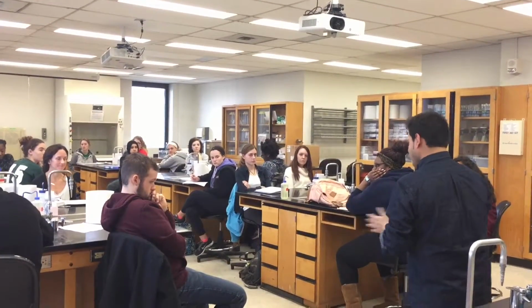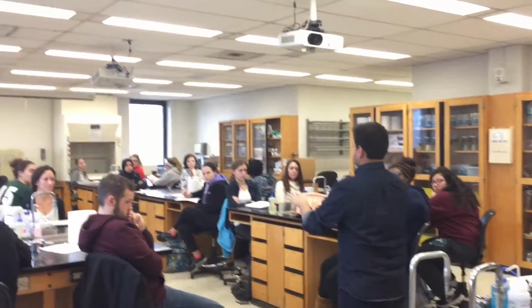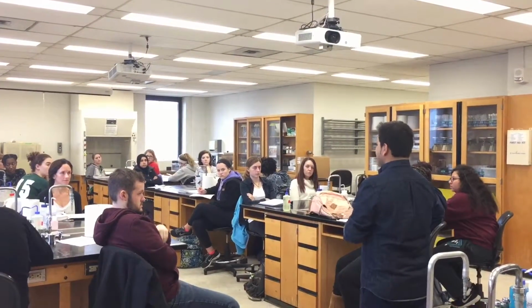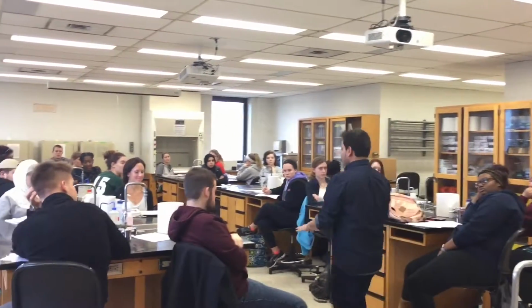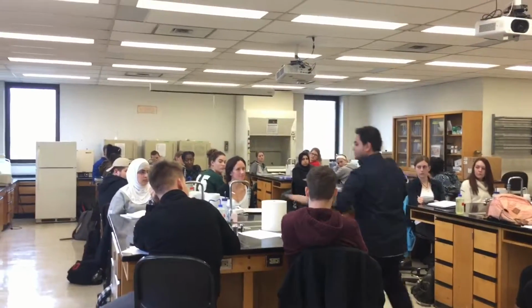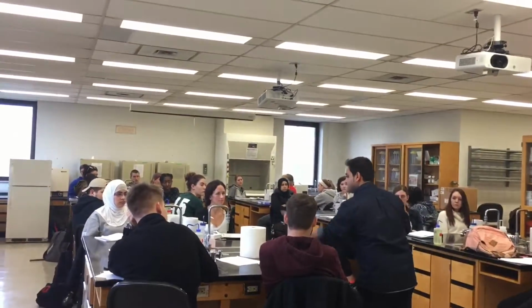Did that make sense? And in the context of this lab, after working you're going to go grab lunch, right? You don't want to have some bacteria for lunch. So make sure you clean your hands properly. We have the soap over here. Clean your hands and wipe them with a paper towel before you leave. And just to remind you again, you'll be cleaning the bench with Lysol.